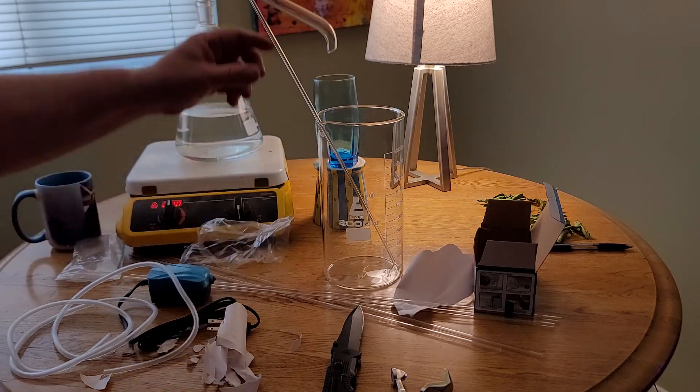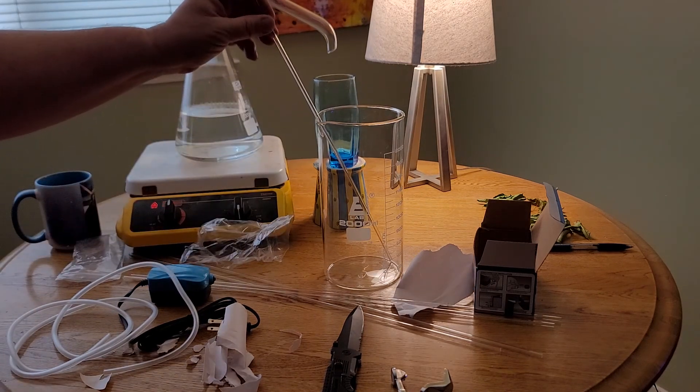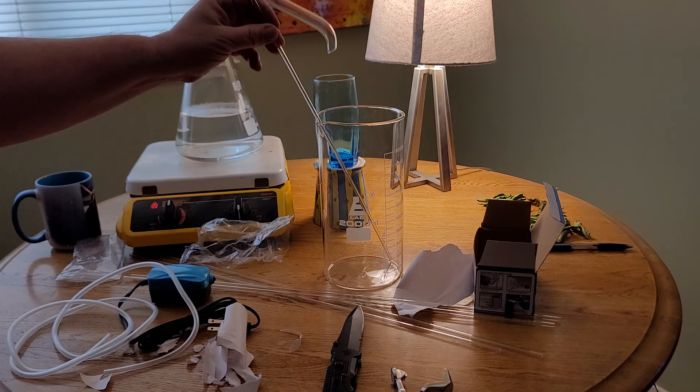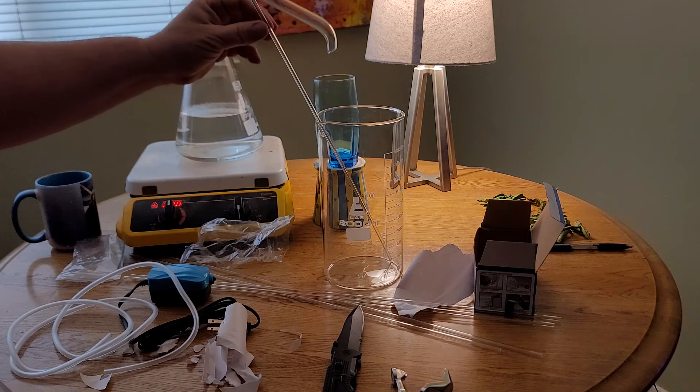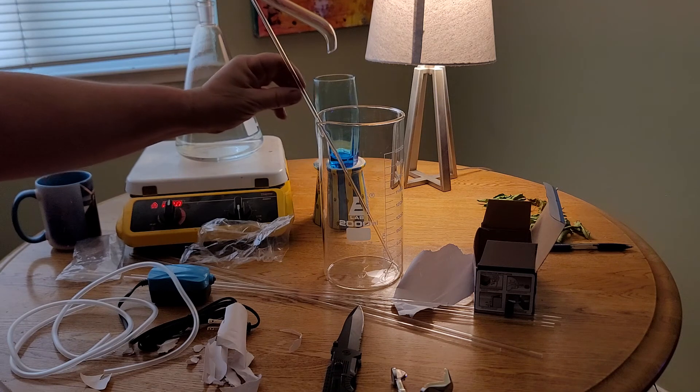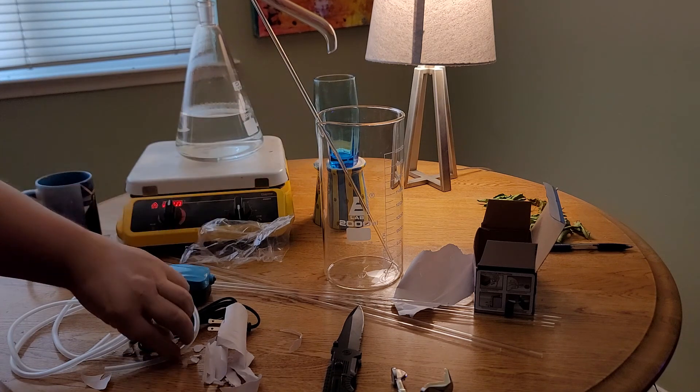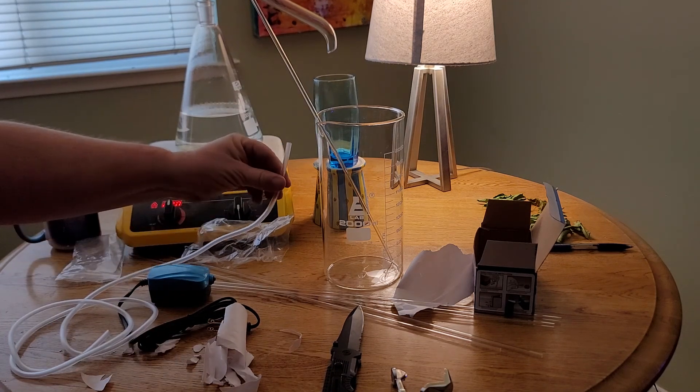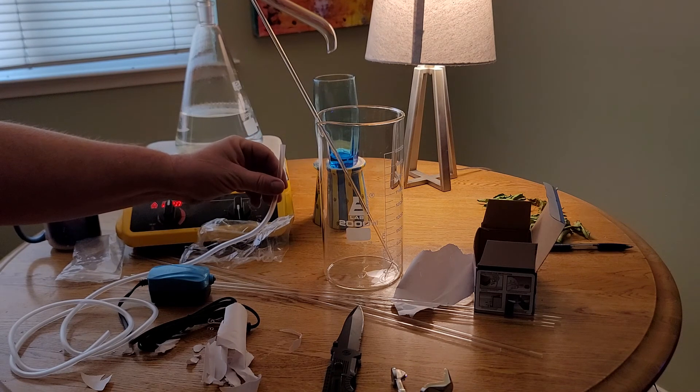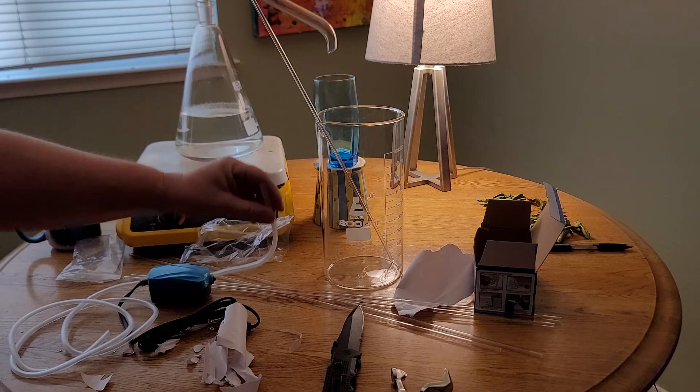But as it is, this glass tube is too tall, so I'm thinking about cutting it off and maybe putting a little bend in it like a straw, maybe a little hook, and then connecting this tubing to it.